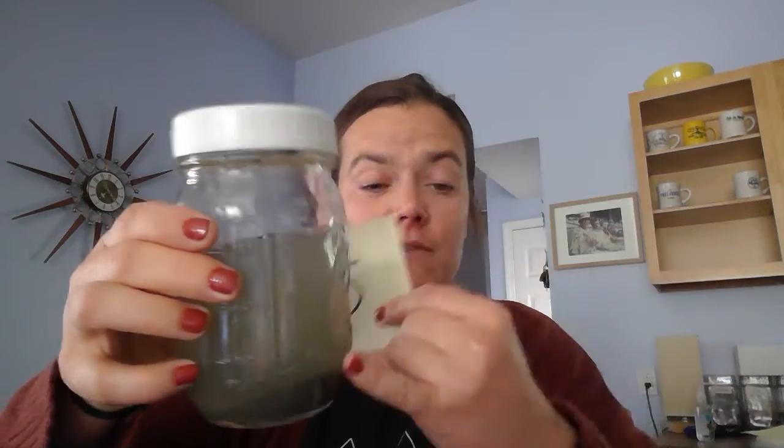All right, this one's tough. This one is kitty litter. Yuck. Again, it smelled really weird. So obviously probably not something that you want to consume, because there are a whole bunch of chemicals in kitty litter to help keep the smell away. So how do you think we could get this out of our water? What would we have to do to get this chunk out and the stuff here? How do we clean our water?